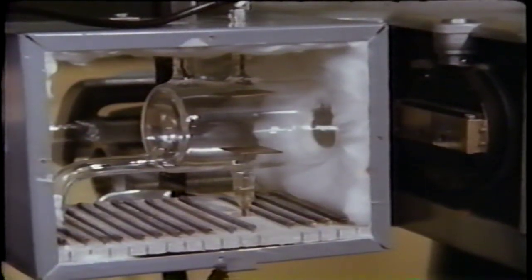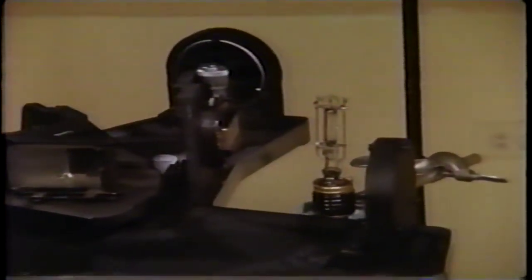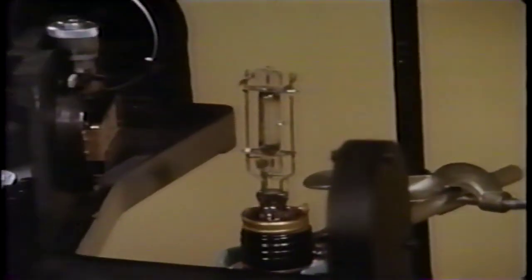This cell is placed in an oven and contains 2 electrodes, so that the electrical conductivity of any gas between them can be measured. The wires through the cell walls connect the electrodes to a battery, so that an electrical current flows when ions are formed in the gas. For this experiment, the source of energy used to ionize the gas will be light from a mercury lamp. The light is directed by a series of mirrors through a quartz prism, which will separate the light into a sequence of energies or colors.